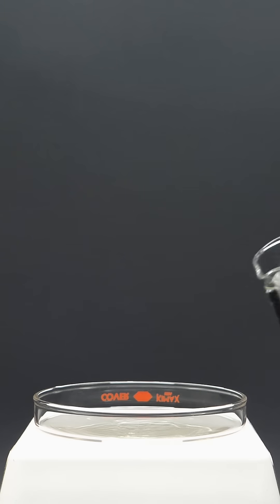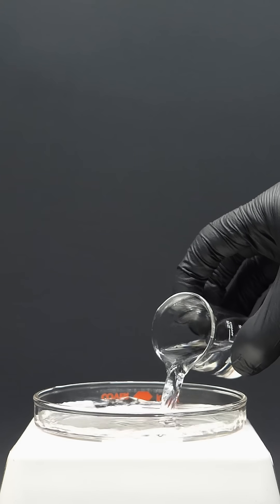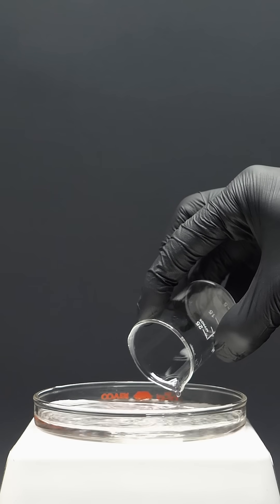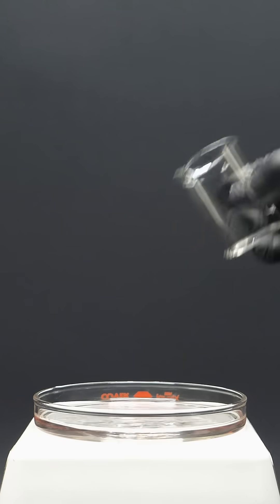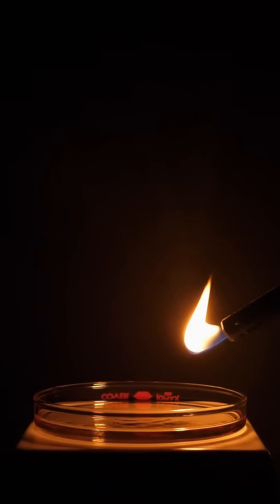What I think is even cooler though, is what happens when I burn nitromethane. It actually doesn't burn on its own, and I have to give it a boost with some methanol.